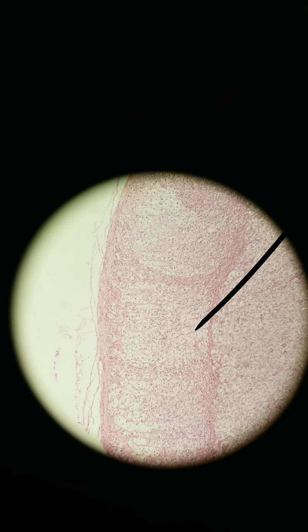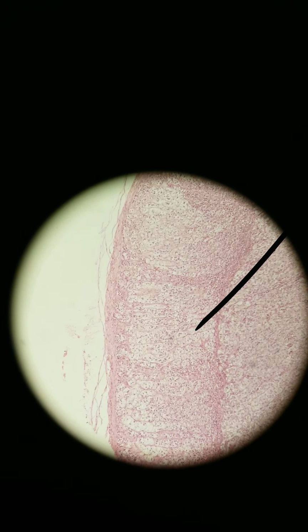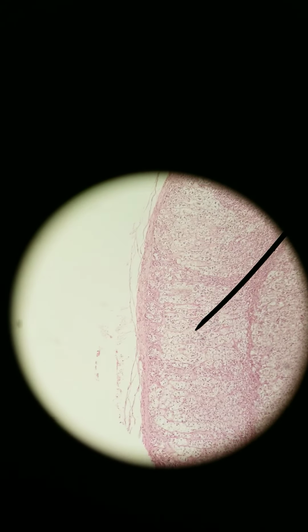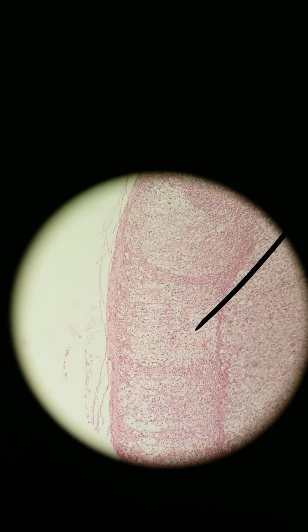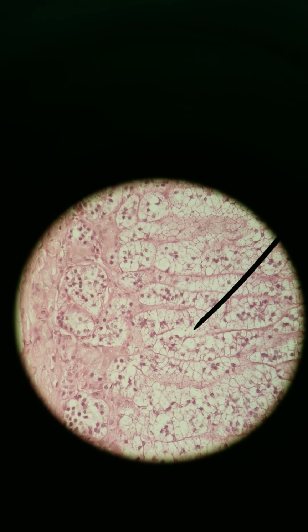This larger middle layer, which seems pretty light colored, like from here to here, I'm at 100x by the way, this lighter colored area, think of these as bundles, and we've learned the term for bundle before. It's a fascicle. This is Zona Fasciculata. Let me go to 400x so you can see what it looks like closer. So these cells just take up a lot more space. It's a large area, it's called Zona Fasciculata.